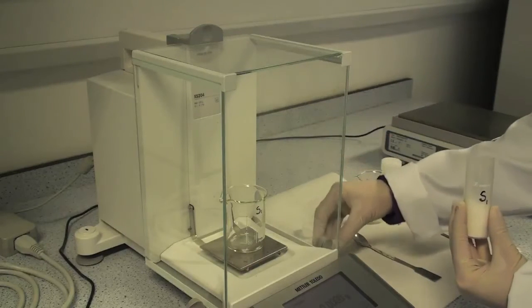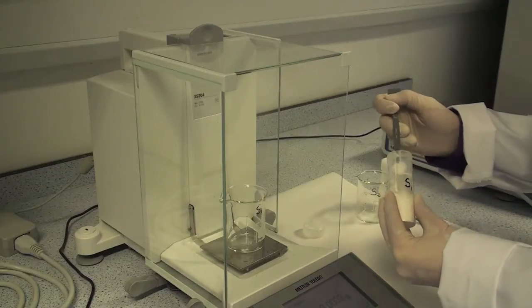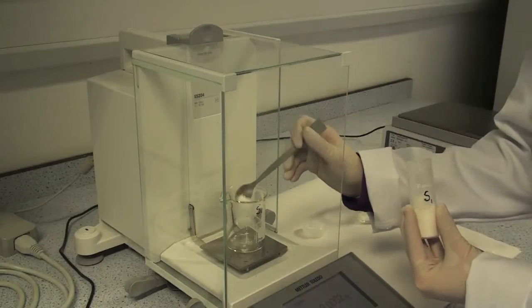For samples containing 0 to 12% fructan, accurately weigh 1 gram of sample into a dry Pyrex beaker of 100 ml capacity.